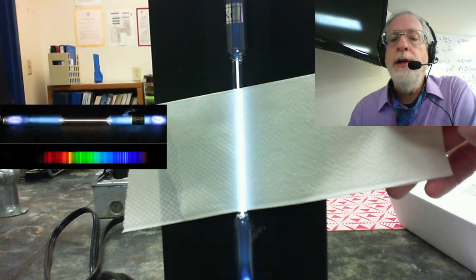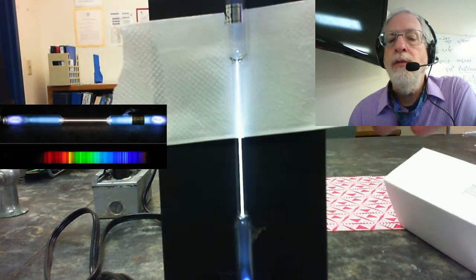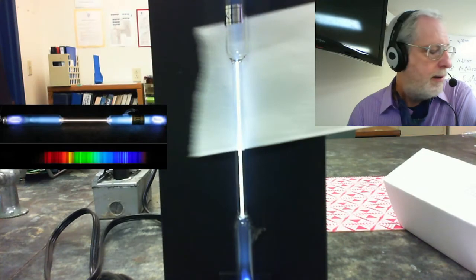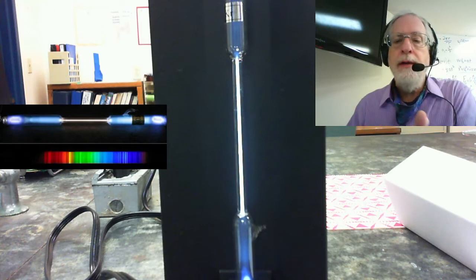And you'll notice here, and this is why I put the white piece of cloth behind it too, that when you put them all together, it's kind of close to white, maybe with a little hint of blue or purple, but it's really close to a nice white light that you get from krypton. And these are basically what you get from a neon light.